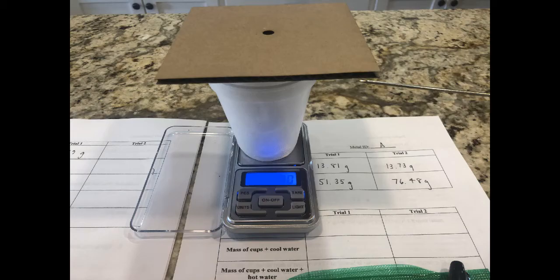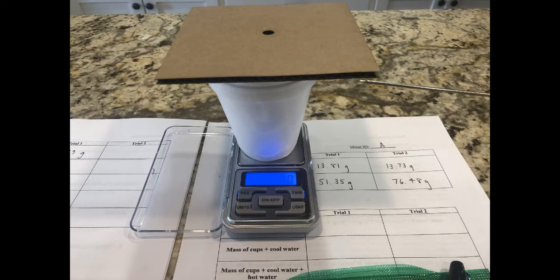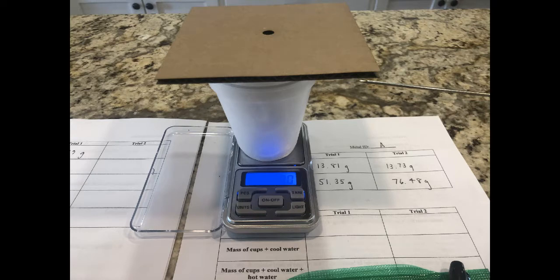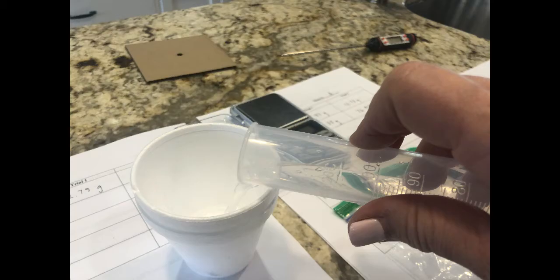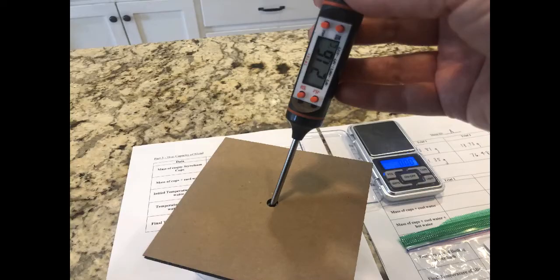Part 2. Get the mass of two styrofoam cups and the cardboard lid — that is the empty calorimeter. Add 40 mils of room temperature water, re-weigh, and measure the temperature of the water.